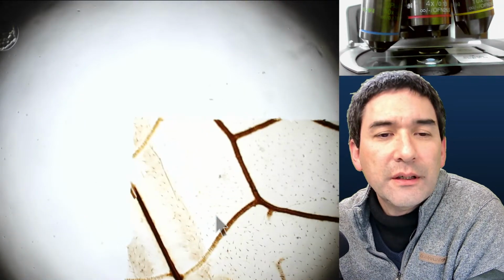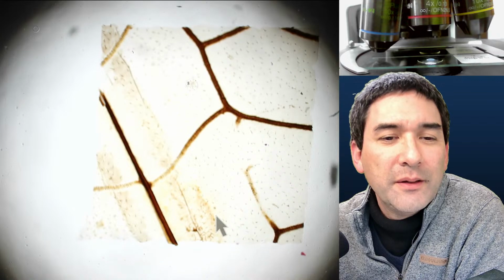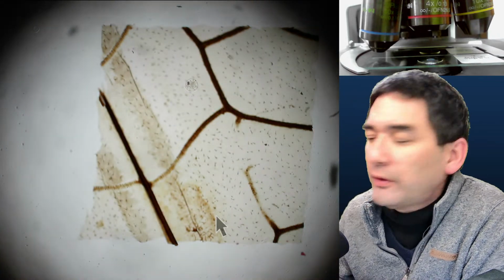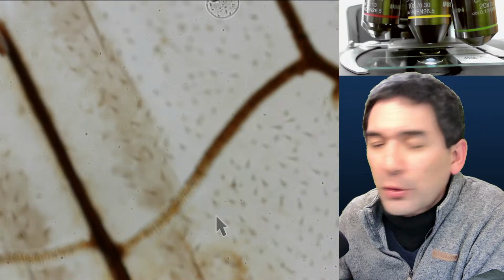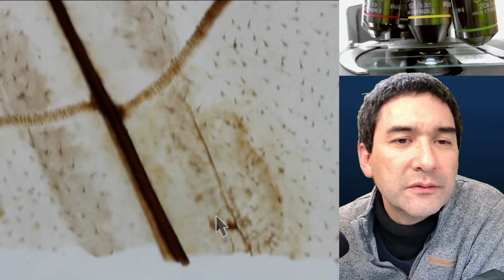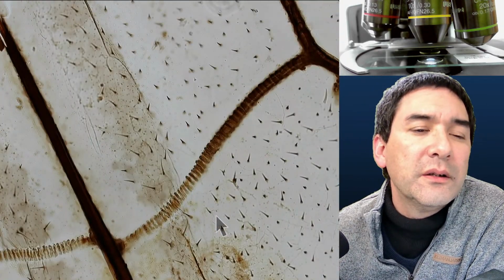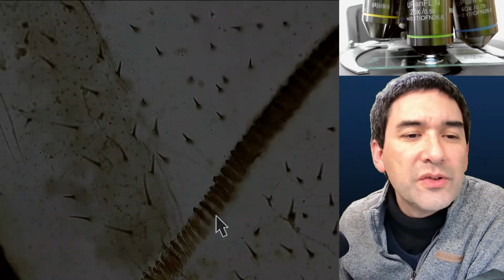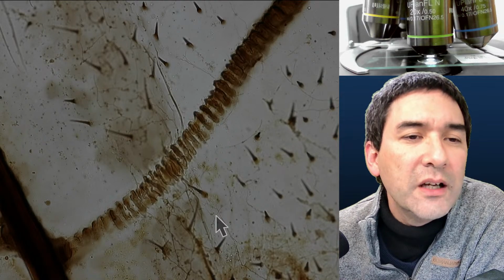Where is this here? Look, that's kind of obvious. It's square. Why? Because, of course, the dragonfly wing is so large that you're not able to fit it on a microscope slide. Therefore, they had to cut it apart. Look, here, these vessels are interesting. That's also quite interesting to see. Could this be some kind of strengthening rings, maybe?